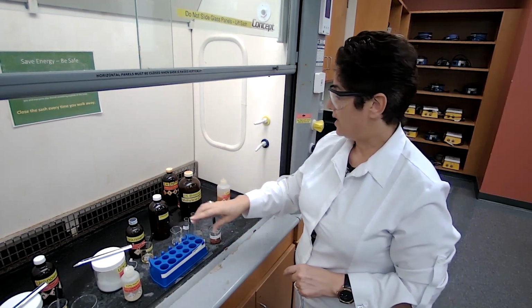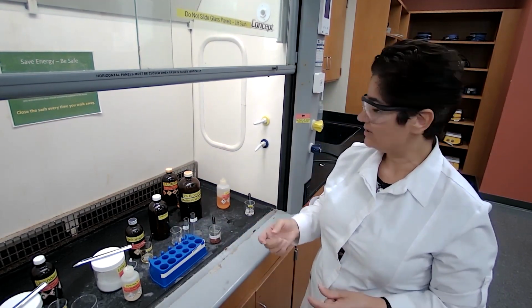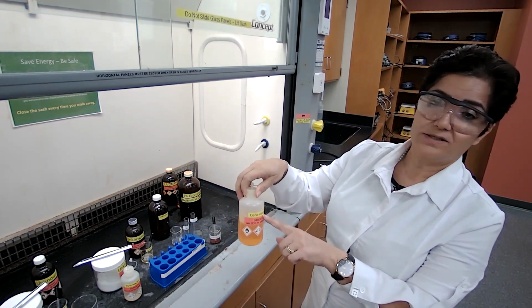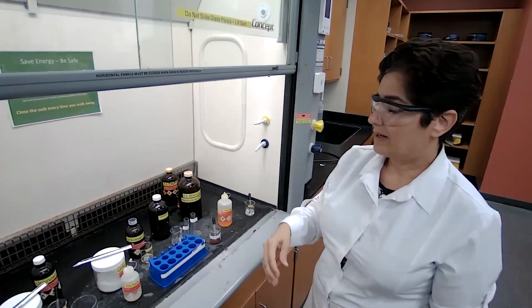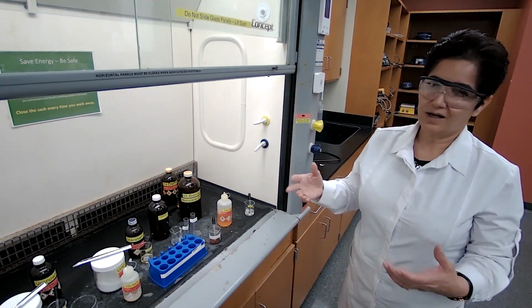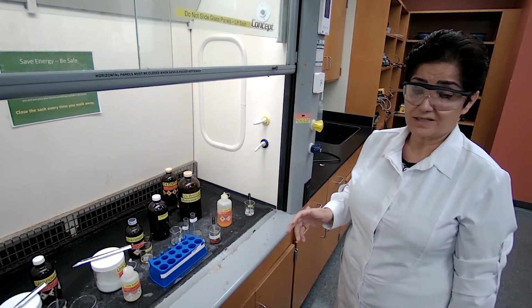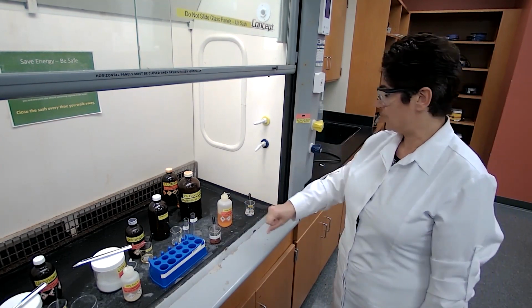The other classification test for the functional group is the test for ceric nitrate. Ceric ammonium nitrate with alcohol gives a positive test, and also with phenol. Your unknown is not phenol because the introduction part of the experiment says you're not testing for phenol, but if it's alcohol, it will change color.